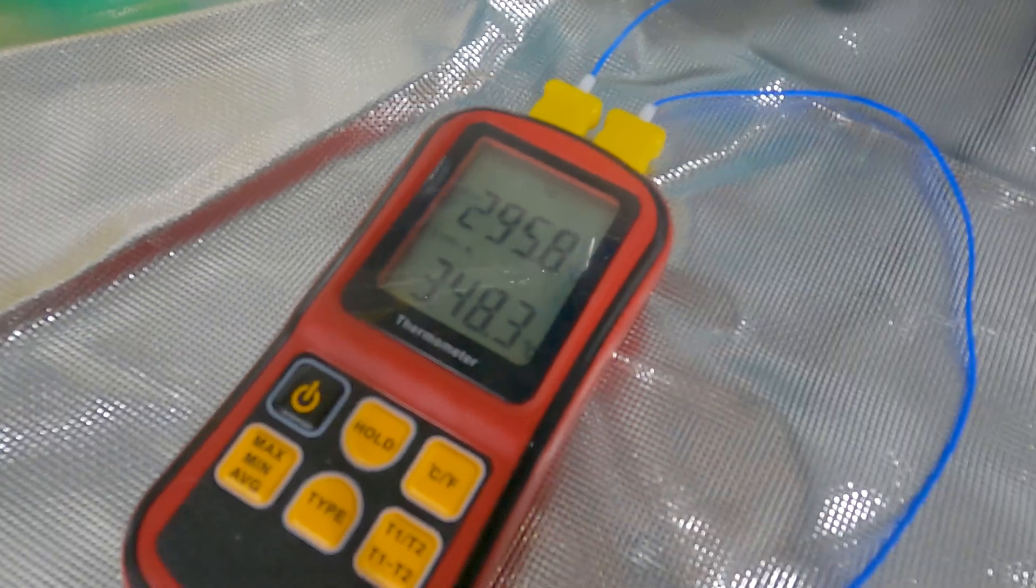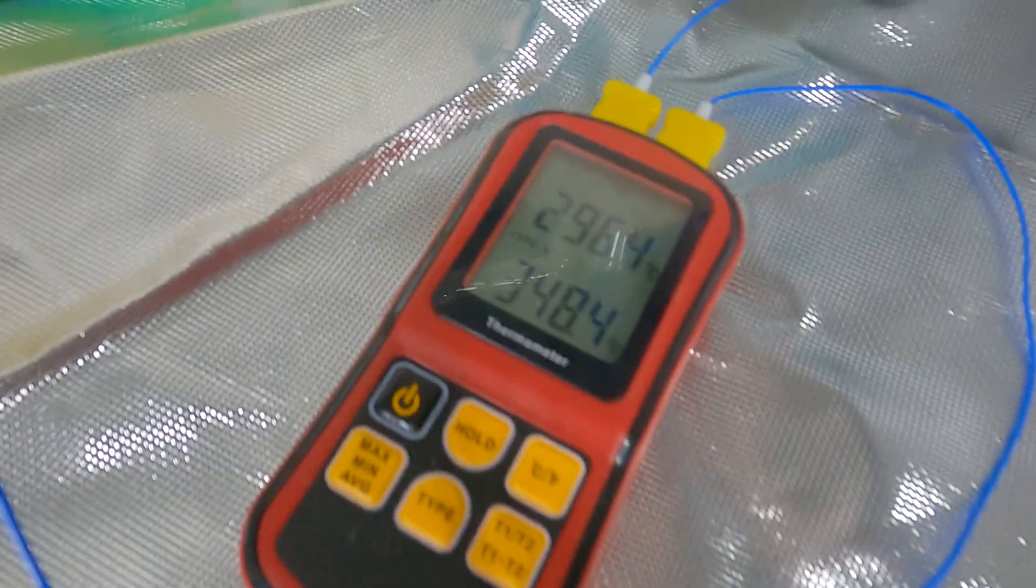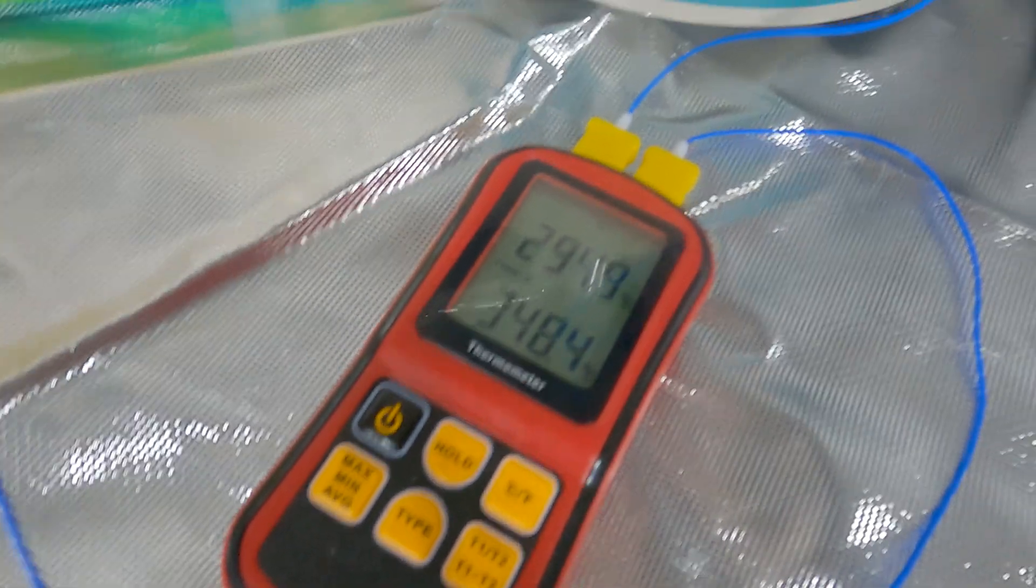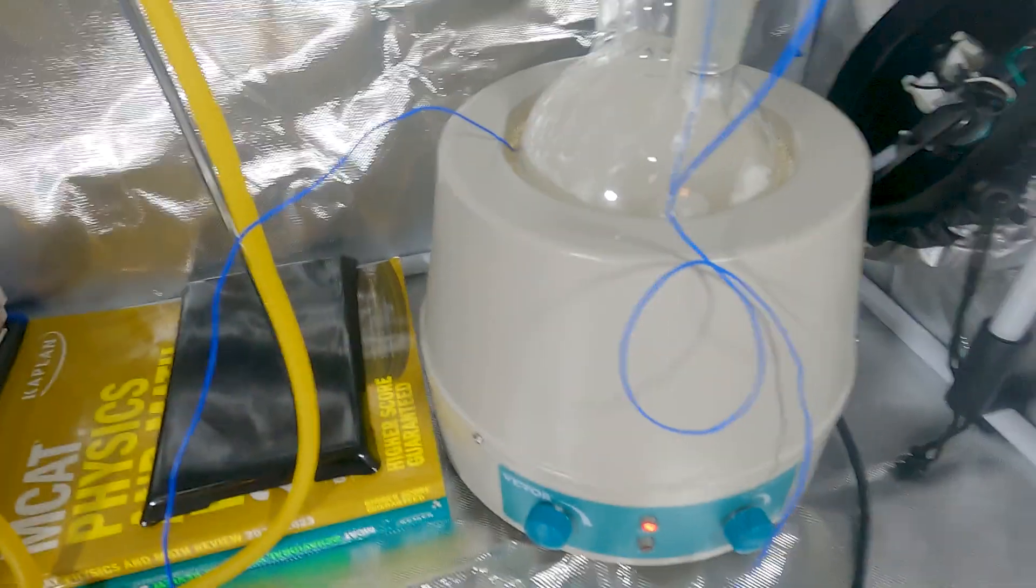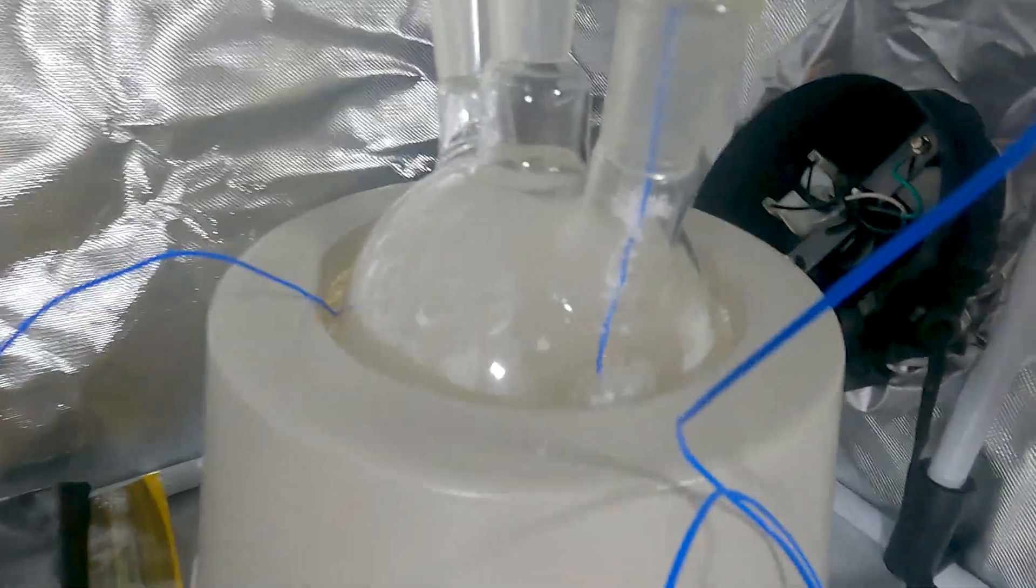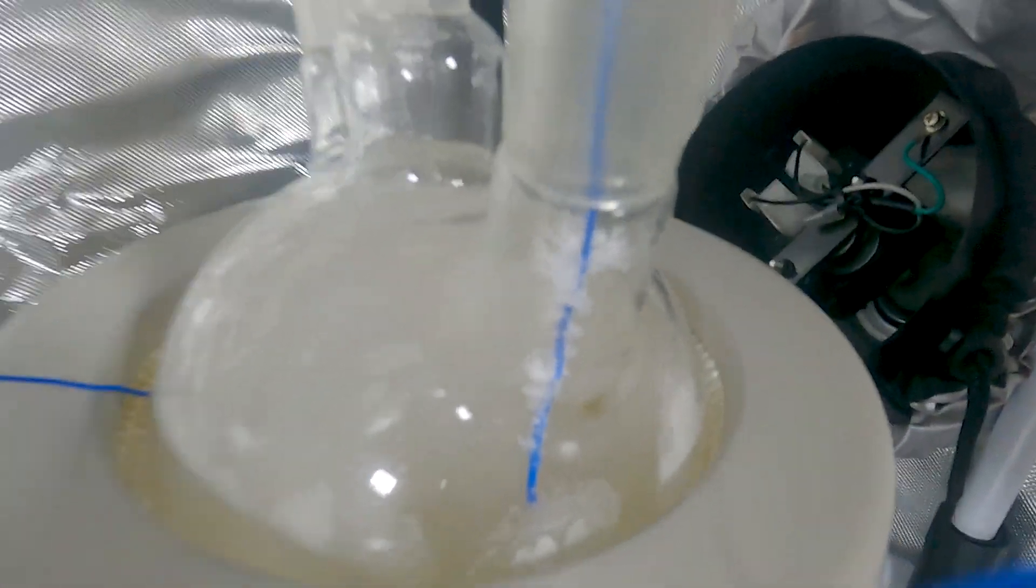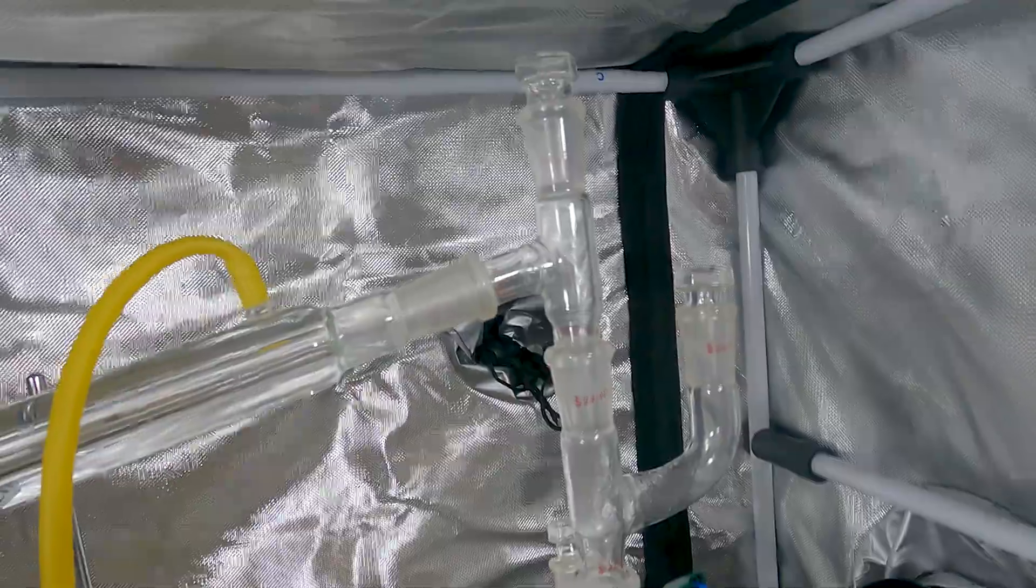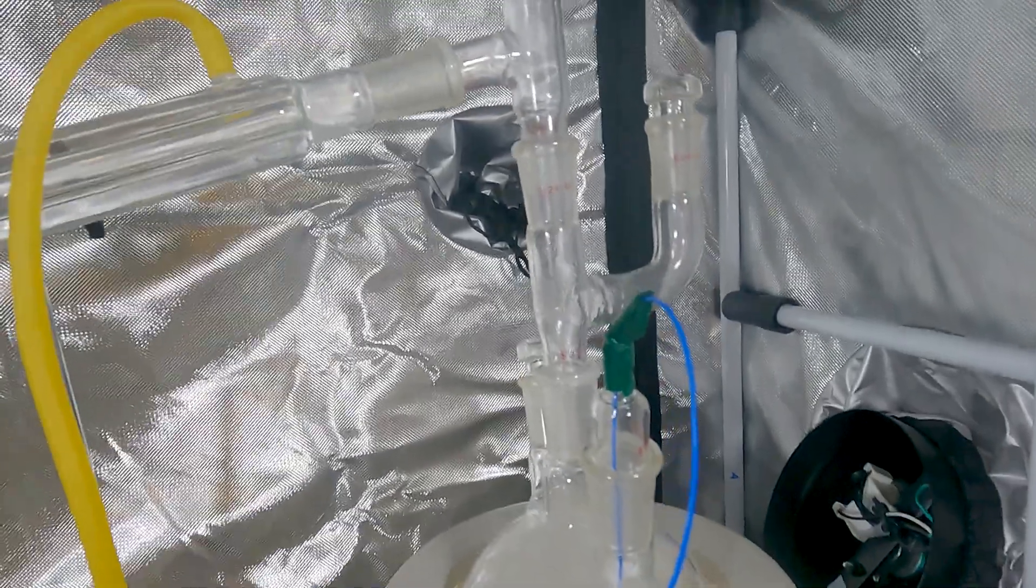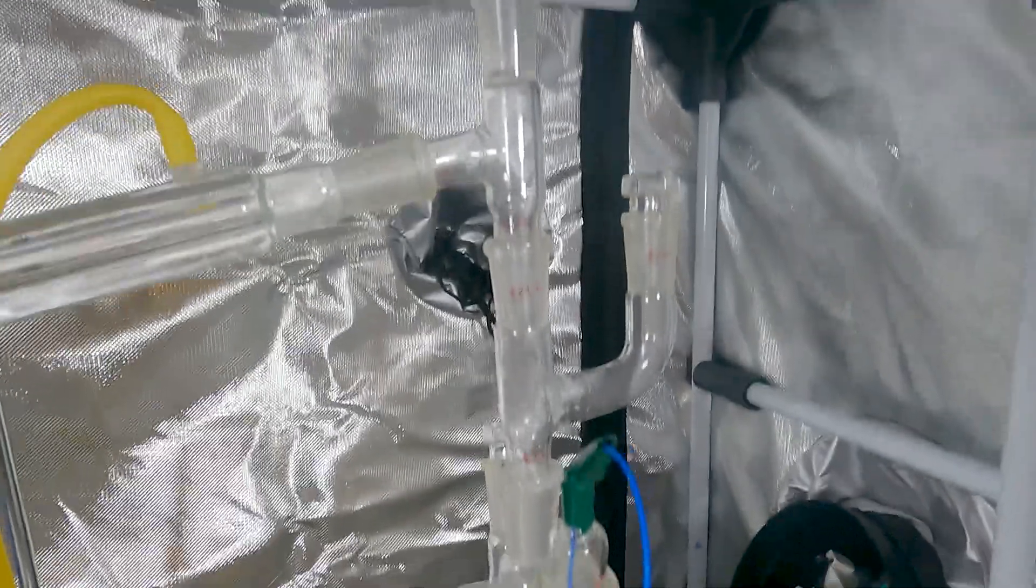Okay, we are at temperature here finally. Took a couple of hours actually. It's very finicky to try and hold it at this temperature and the adipic acid can very easily come over. You can see some on that line right there. I did get some right there, but not too much. So, that's why I extended this column a little bit.